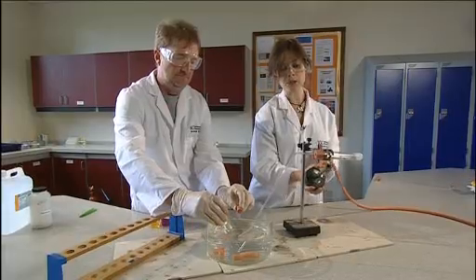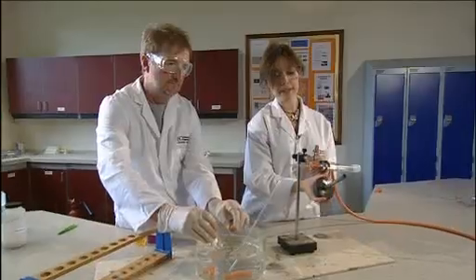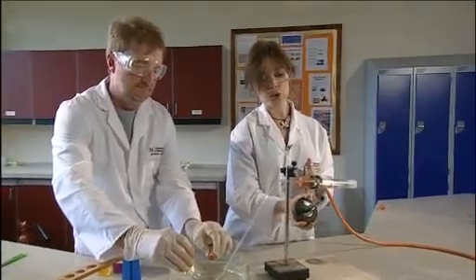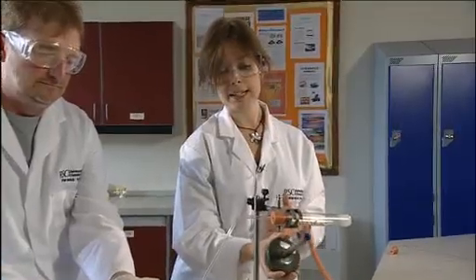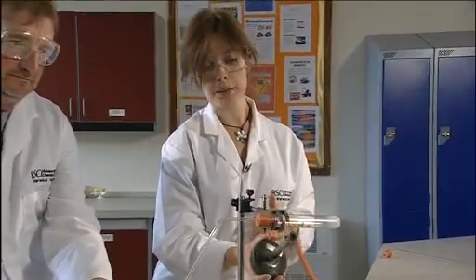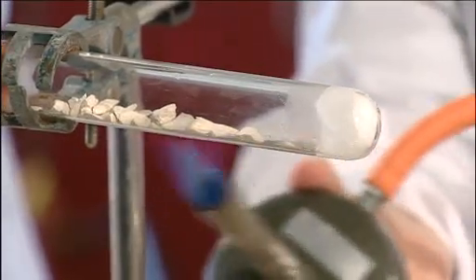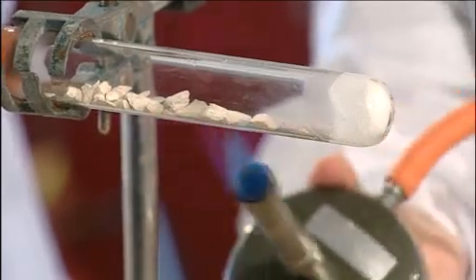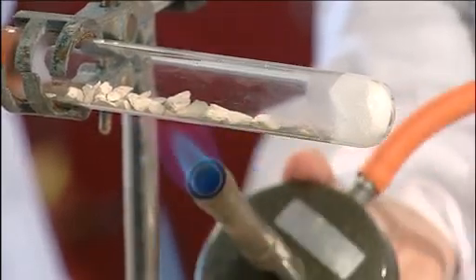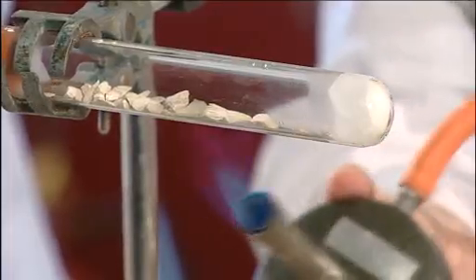Once you've been heating for about ten seconds then you can flick across and just briefly heat your paraffin soaked in the mineral wool. Then go back and keep the catalyst hot. The whole time keep the catalyst hot and then just flick across to start the paraffin evaporating. You want to heat the pumice stone for about ten seconds for every second that you're heating your paraffin.